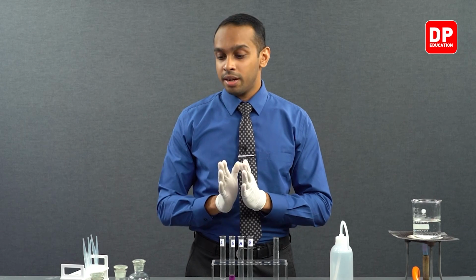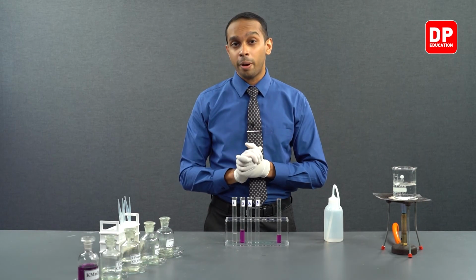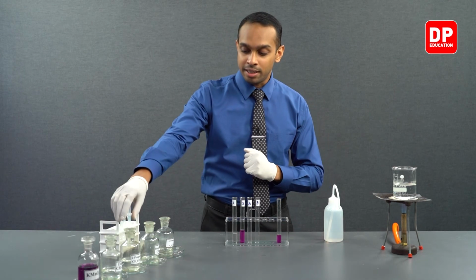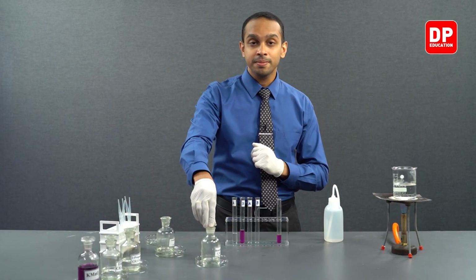Now, let's move on to our aromatic carbonyl compounds. We have two aromatic carbonyl compounds here. We'll first take a look at our aromatic aldehyde, which is benzaldehyde. So we have our benzaldehyde reagent here.